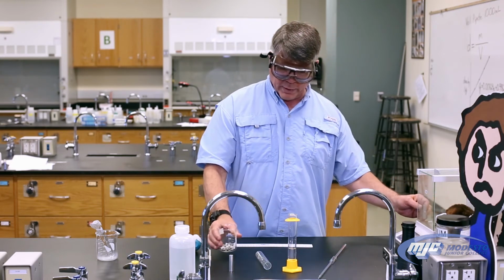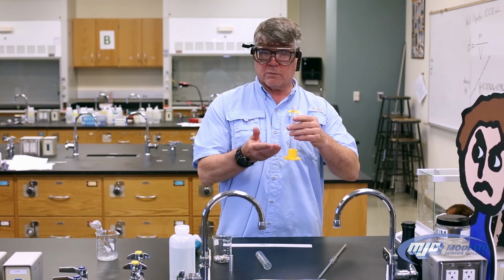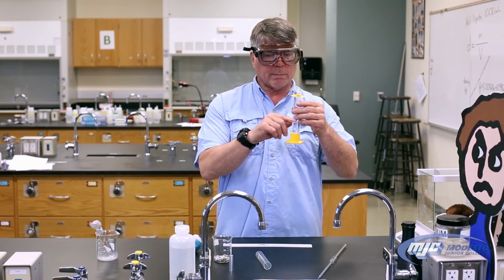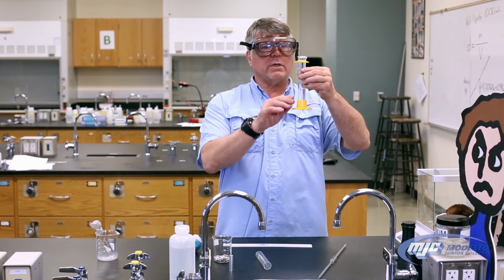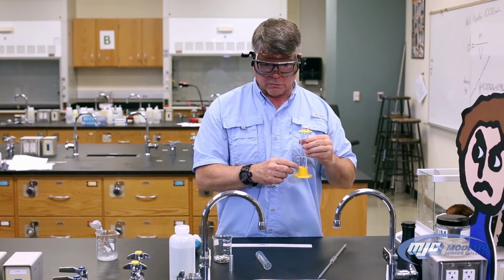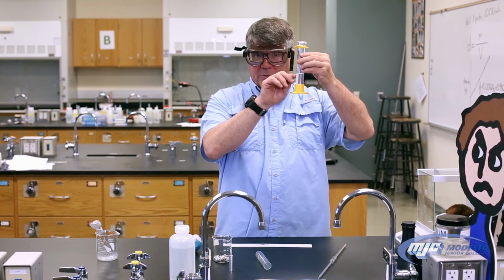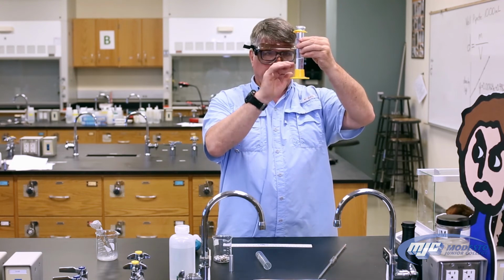Once we have the metal shot weighed, it's in the beaker. You're going to take a graduated cylinder and put some tap water in it, just about halfway, and you're going to read the volume, the initial volume of that water. Each trial. The initial volume for the first trial will be your B3. Remember, this is 1 place past the decimal, and it's in milliliters. Read that and record it.